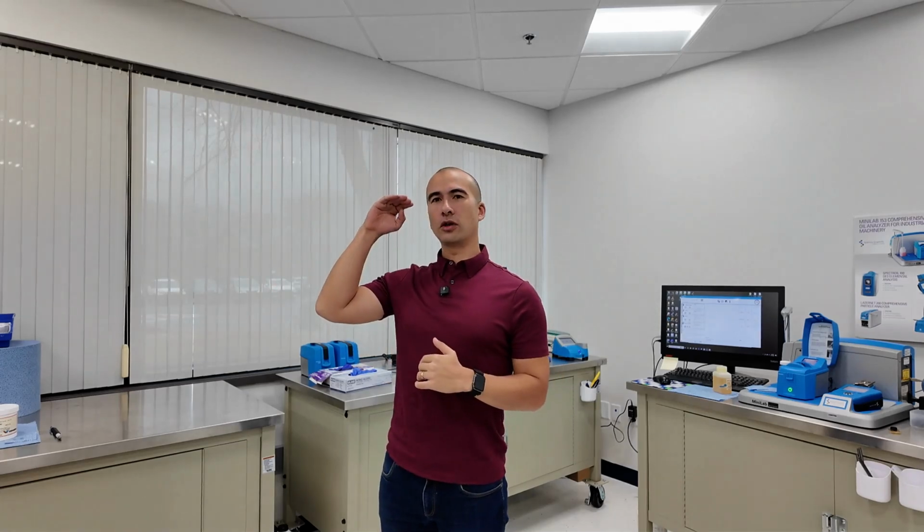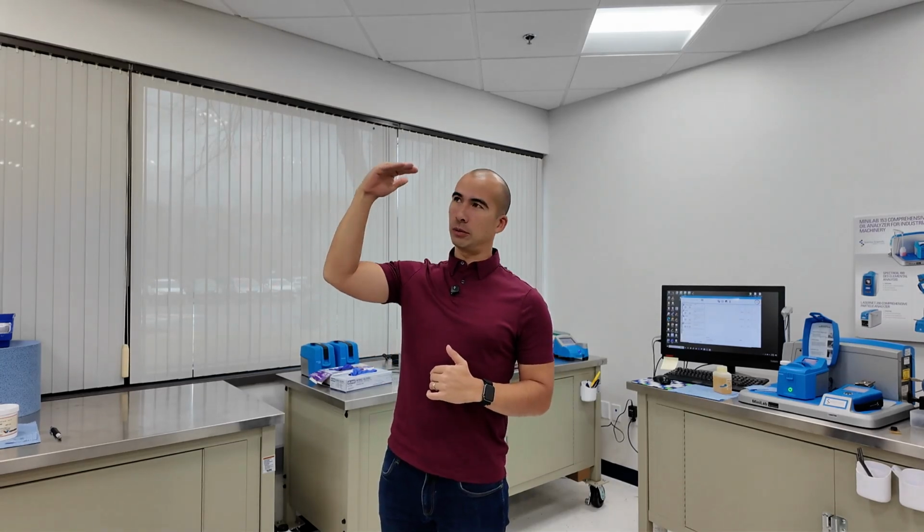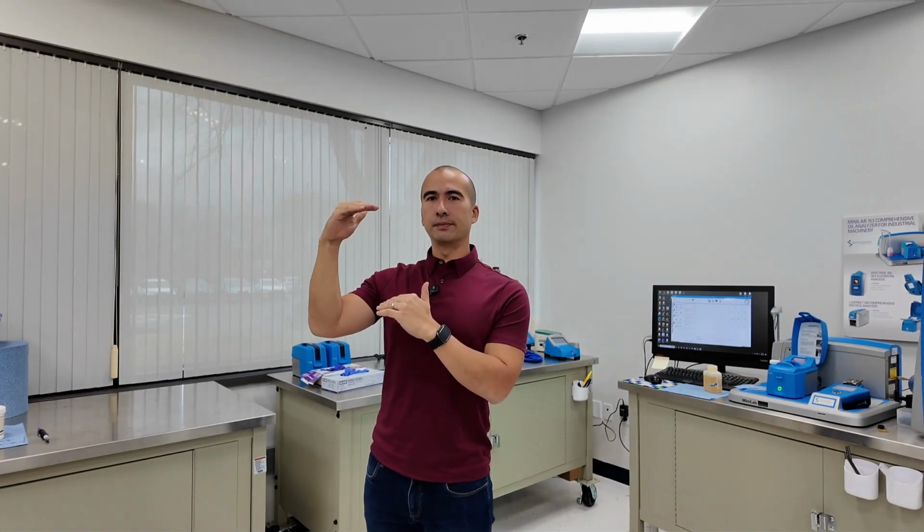We're at Spectro Scientific today, and I thought it'd be worth going through some of their field analysis kits. If you remember when we talked about oil analysis in the past, there's a couple of different levels of oil analysis, so to speak. You've got your sensors, which happen to be real-time monitoring. That's probably layer number one. Layer number two is the field style oil analysis.